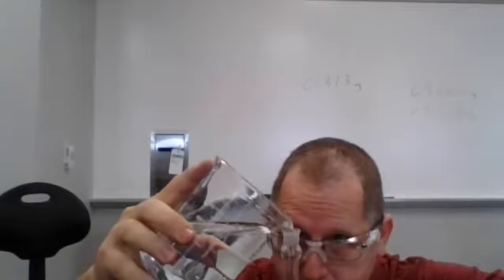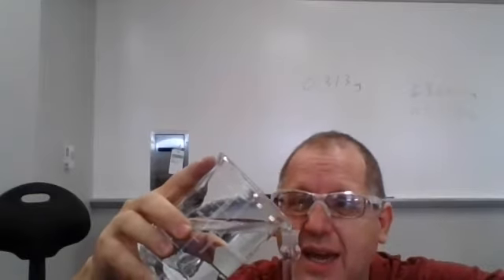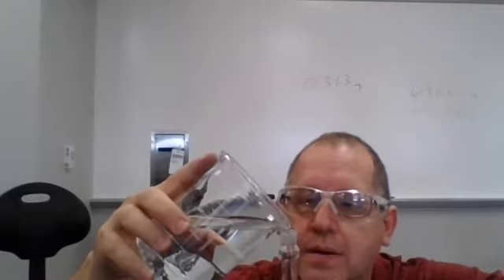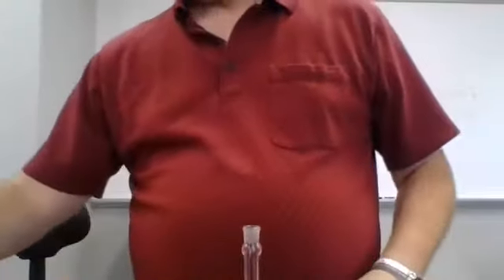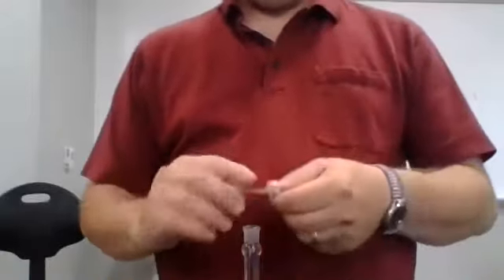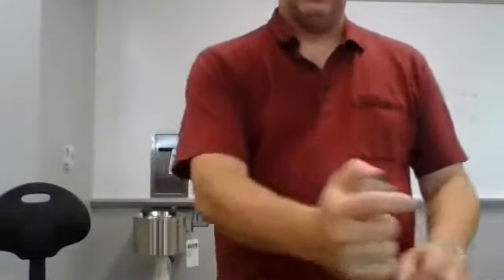And I am going to pour this just to prove that I can actually fill right at the line. Just perfect. Okay. Again, covering that with parafilm. I am going to mix that. And this is now my 10 parts per million properly made solution. So I'm going to leave that here where we can see it. Now we're going to need that. Now I'll probably mix it up a little bit more before I use it.